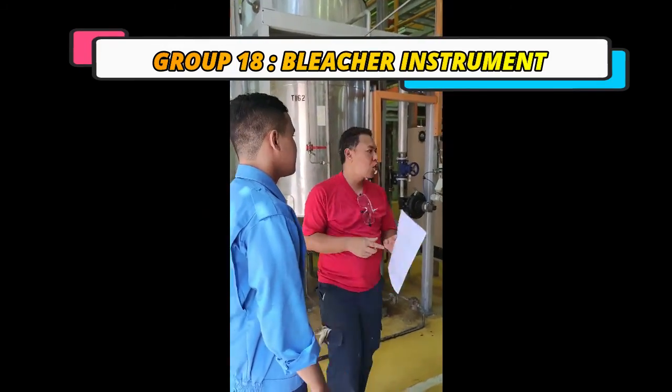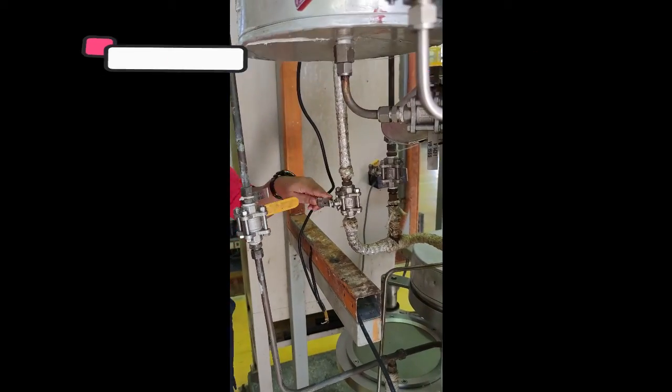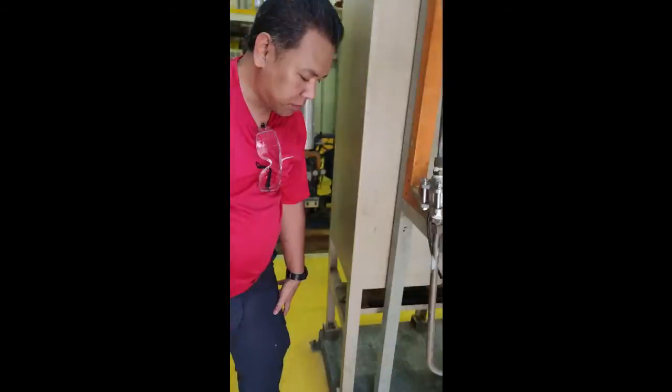Assalamualaikum warahmatullahi wabarakatuh. We are from group 18 and today we will discuss about the bleacher instrument. Let's go to the pilot plant.